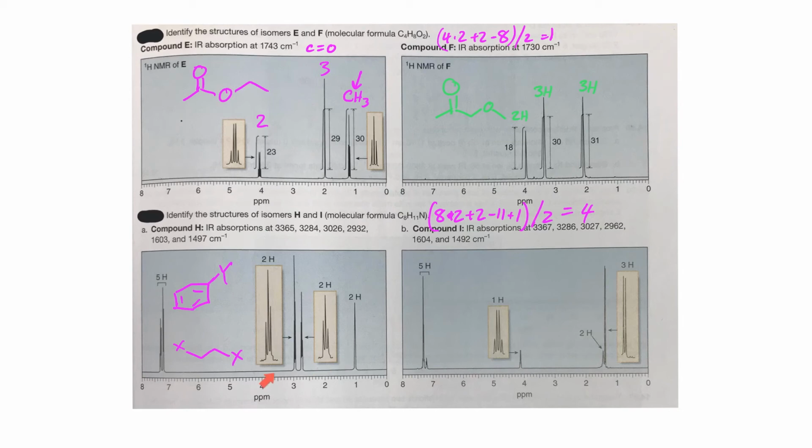Let's count our carbons and find out. I have 6 here, 7, 8. I've accounted for all 8 carbons. I've got 5 hydrogens here, plus 4 more is 9. I'm missing 2, that's what these 2 are. So most likely, this is an NH2 group, and that has 1 bonding partner. And so I think I can put these together because I have something with 2 bonding partners, a piece with 1 bonding partner and another piece with 1 bonding partner. So I'm going to erase my Y and just fill in the rest of my molecule.